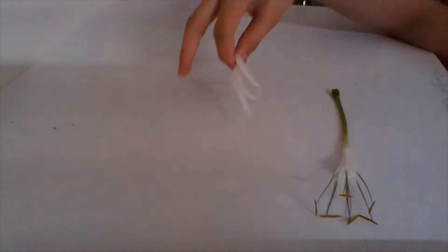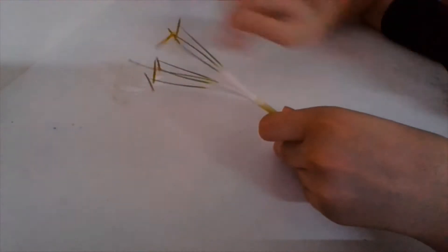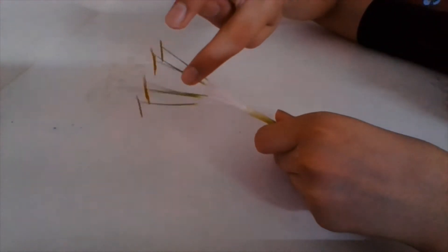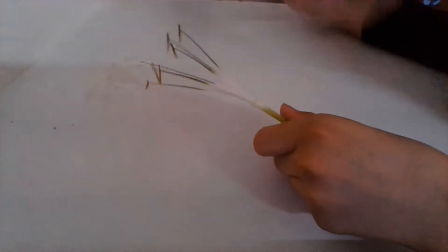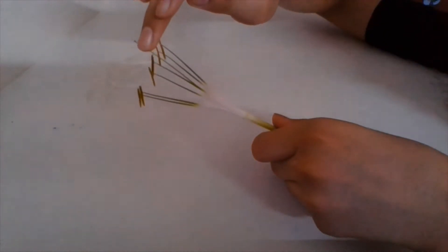We will keep these aside and dig deeper into the male and female organs, starting with the male. Starting with the filament — you can see this is our flower which was left after the petals. These green, small, stem-like structures are the filaments. The filament connects the anther at the top.